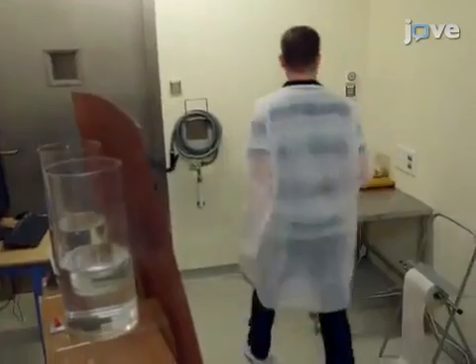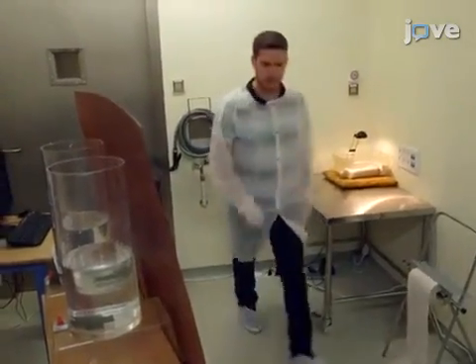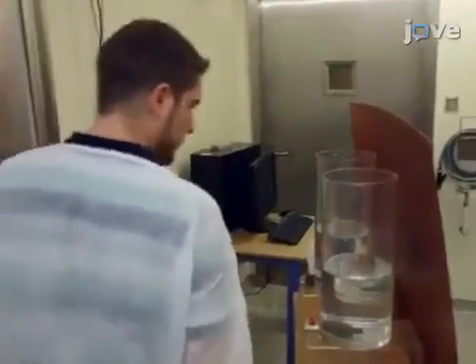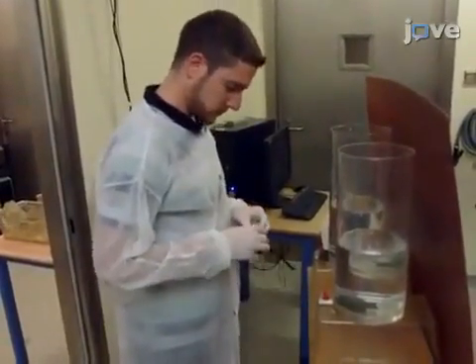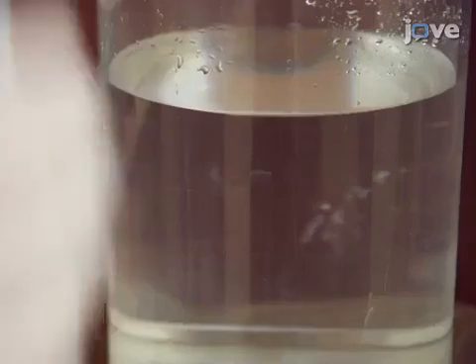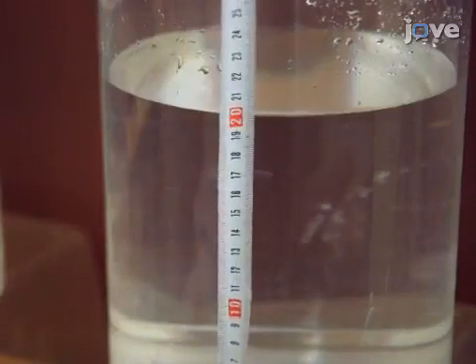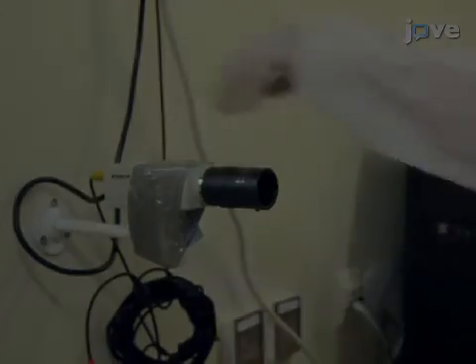For the forced swim test, use two adjacent rooms — one room as a waiting room for holding the animals prior to behavioral testing, and the other for carrying out the procedure. Prepare transparent cylindrical glass containers measuring 50 centimeters in height with a diameter of 20 centimeters. Next, prepare a video camera.